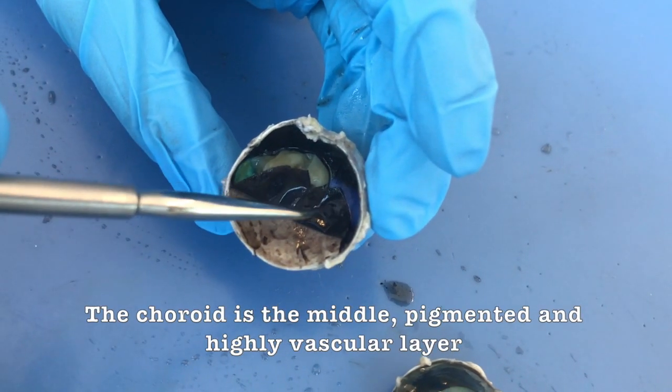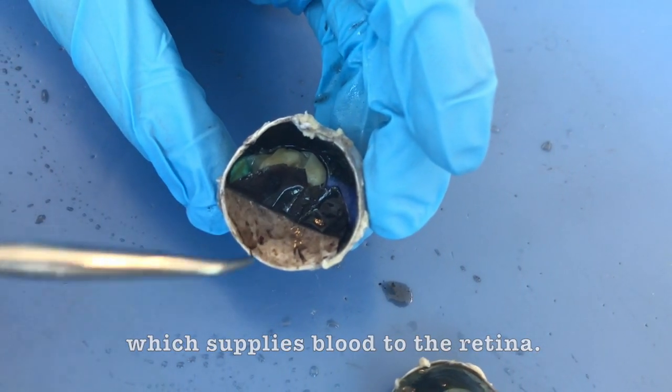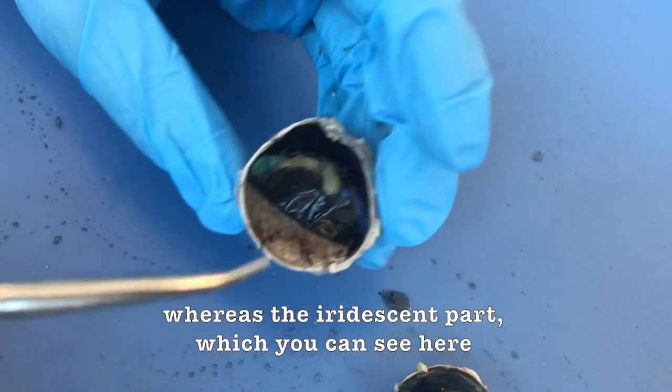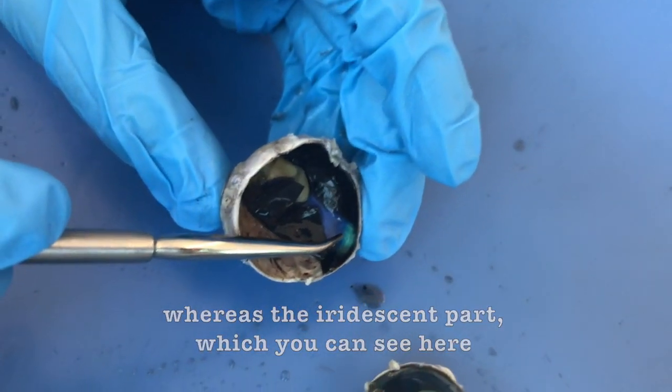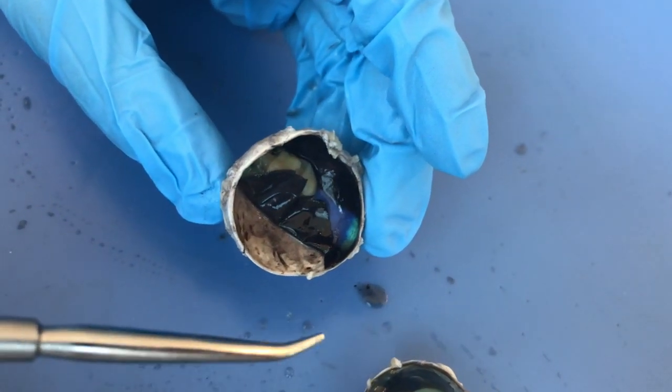The choroid is the middle pigmented and highly vascular layer which supplies blood to the retina. The dark pigment also helps to absorb light, whereas the iridescent part, which you can see here, is for additional light reflection in the dark for night vision.